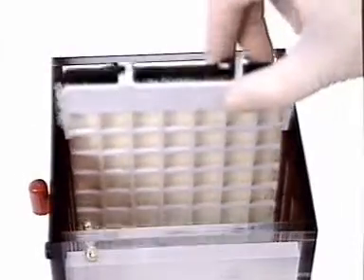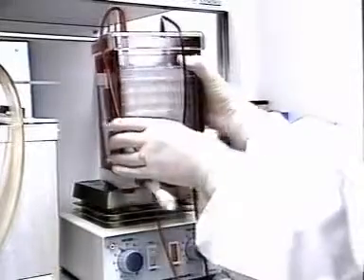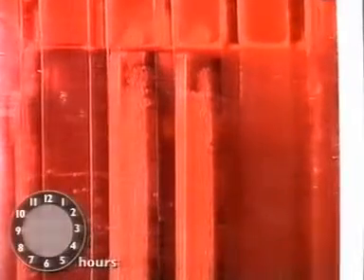The package is placed in a transfer tank which is water-cooled. The tank itself is filled with electrolyte. An electric field is applied across the layers. The large protein molecules, coloured yellow in the diagram, move to the surface of the nitrocellulose. The small blue dye molecules pass through the nitrocellulose and the blotting paper to be absorbed by the foam.